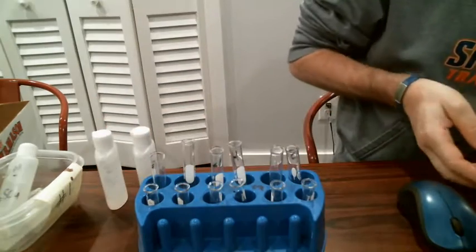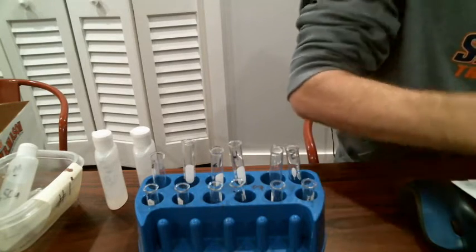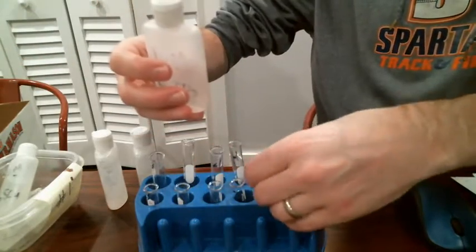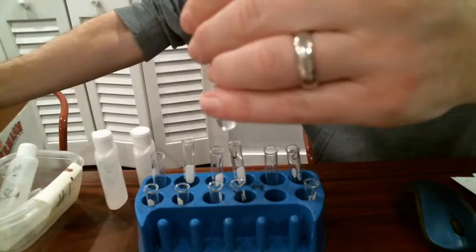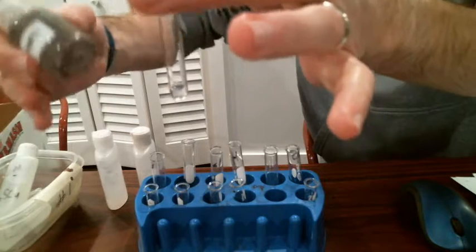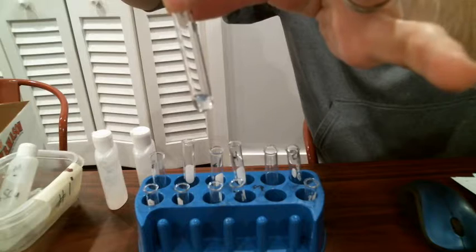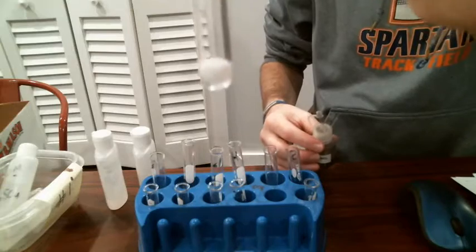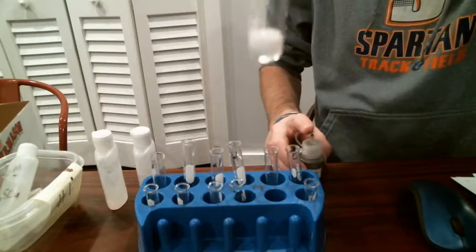Moving on to number two. Just flipping pages here. Number two, we have sodium carbonate with silver nitrate. So start with my sodium carbonate, and then let's add in some of that silver nitrate. Try to make it so you can see it a little bit better. And notice you can see it a little bit better this time, kind of floating more at the top part of that solution, that solid precipitate.